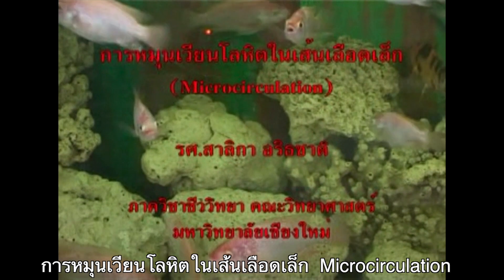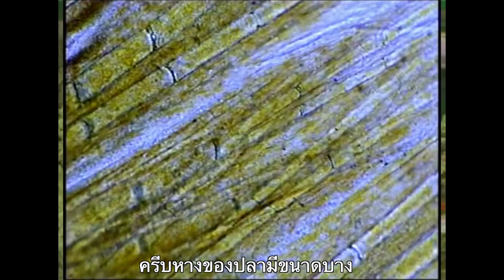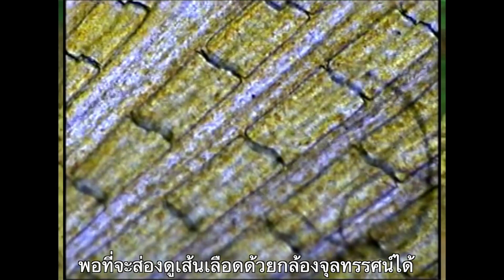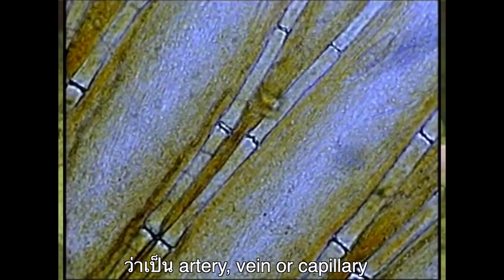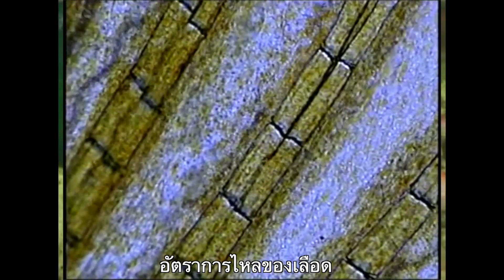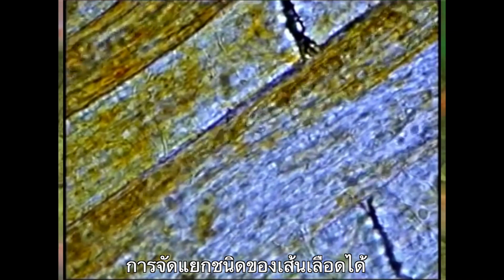Microcirculation. Fish tails are used to study the circulation of blood in small blood vessels because fish tails are thin and easy to observe using a microscope. We are able to differentiate arteries, veins, and capillaries by the direction of the blood flow and the movement of the red blood cells. The objectives of this study are to examine the microcirculation in a fish's tail and to identify the different types of blood vessels.